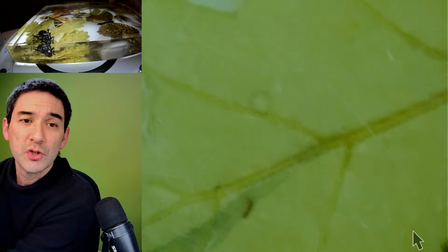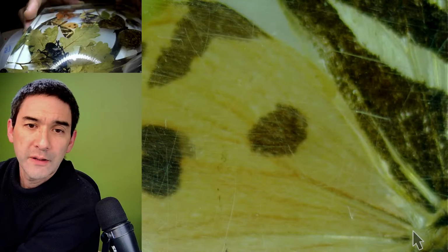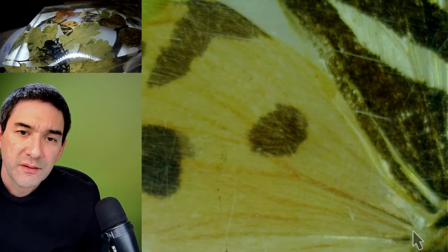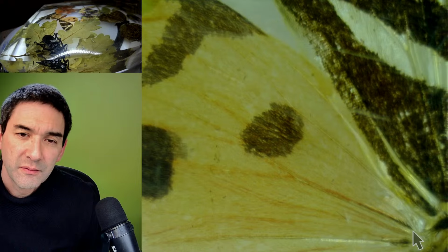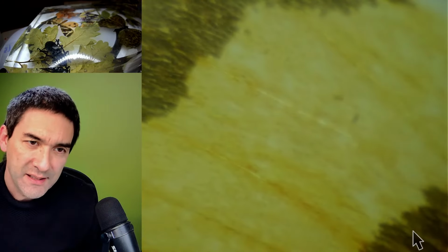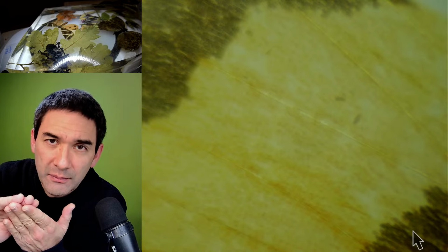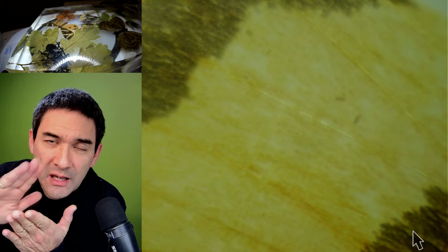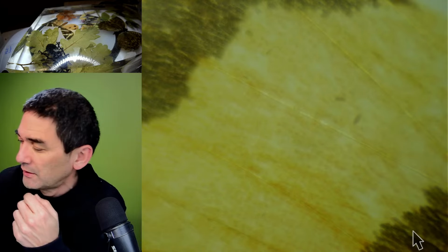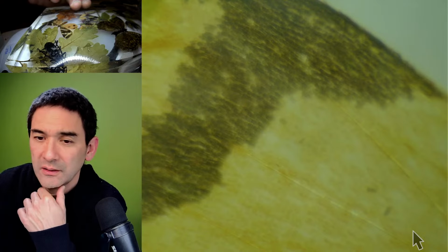Again, same issue with the scratches. A butterfly, maybe we're able to see the scales. Have to focus. It's not residue of the tape alone, but somehow the glue of the tape reacted with the plastic or with the resin. So it's actually a real decoloration. It's not something sticking on top of it, but actually a decoloration. So there seems to be some kind of chemical reaction happening with that.